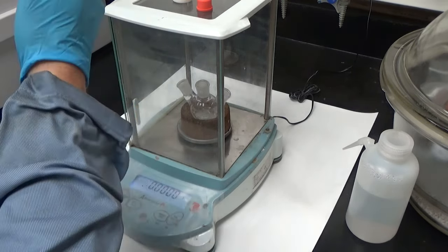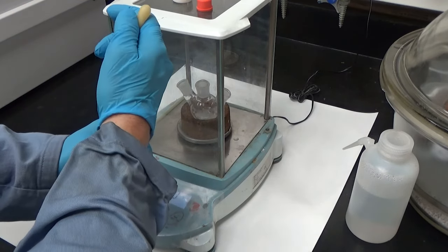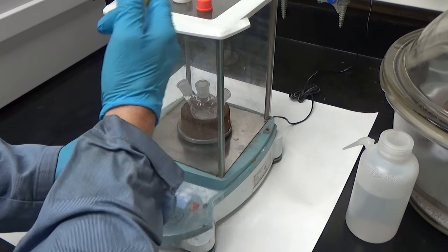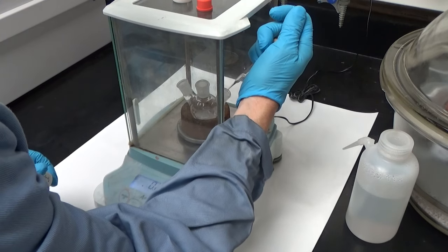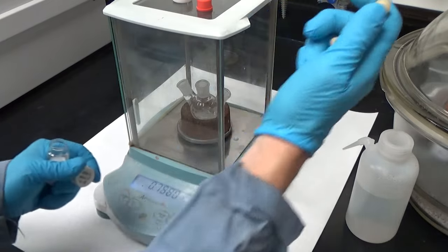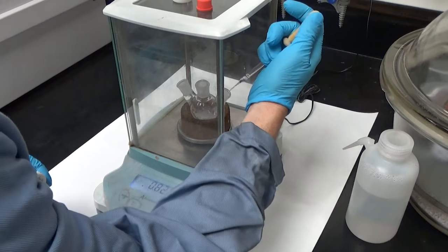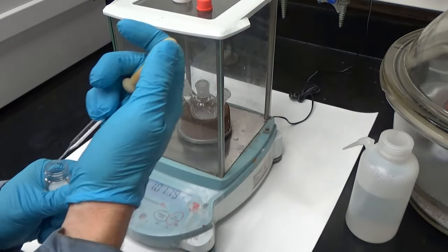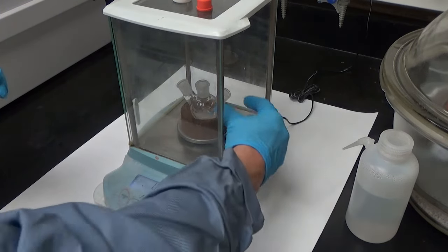Okay, the oleic acid has warmed up and now it's a liquid. We usually would do this one last. Oleic acid, we recrystallize it ourselves. If you buy recrystallized oleic acid, it's very expensive. So we try to be very, very careful with this. So I'm going to weigh out exactly one gram. We have a video on how to recrystallize oleic acid. It's very expensive otherwise. So we make it ourselves and that's nice, but it's kind of painful to make. So again, we're very careful with the oleic acid.